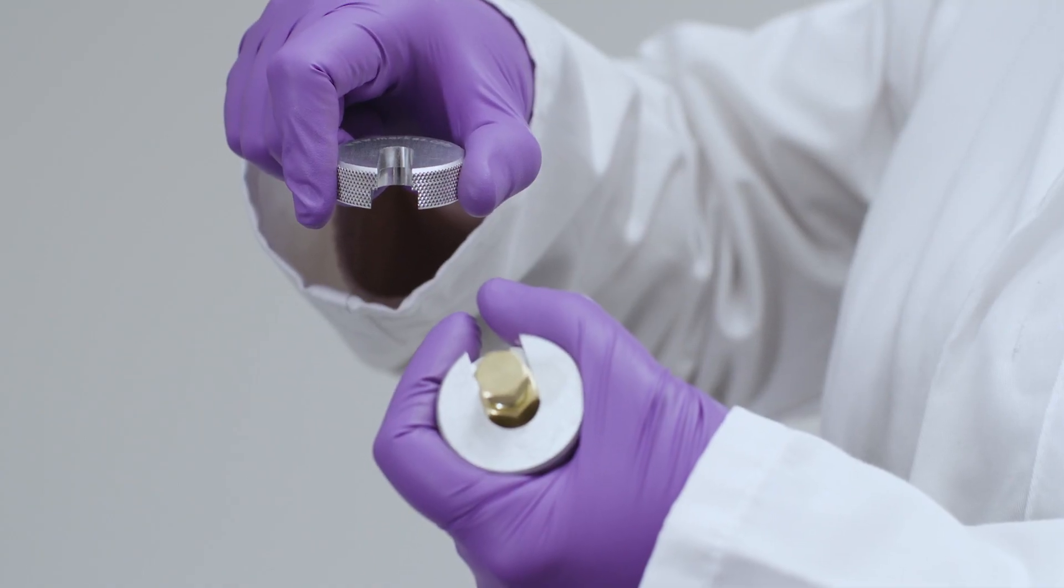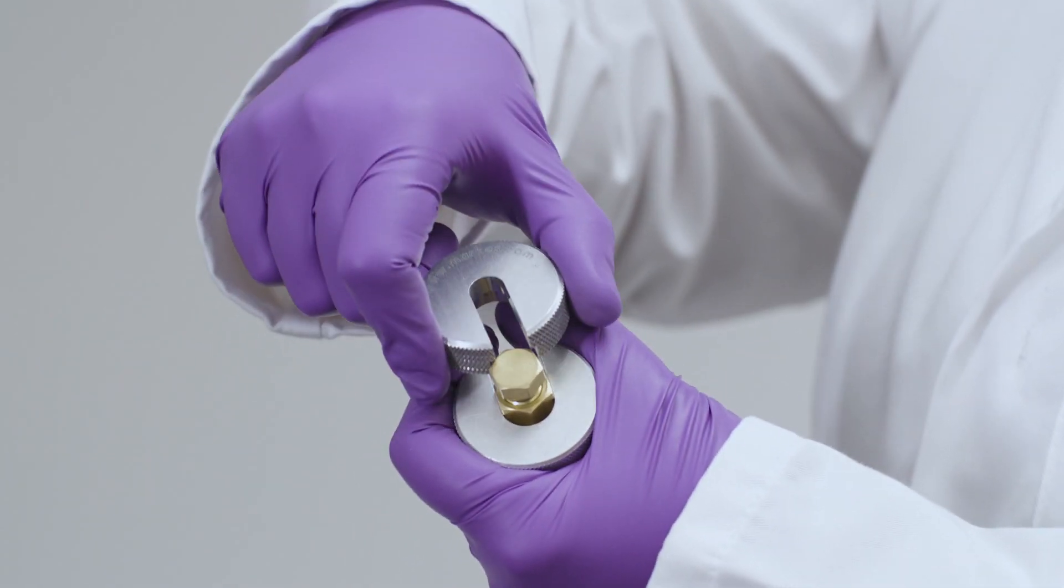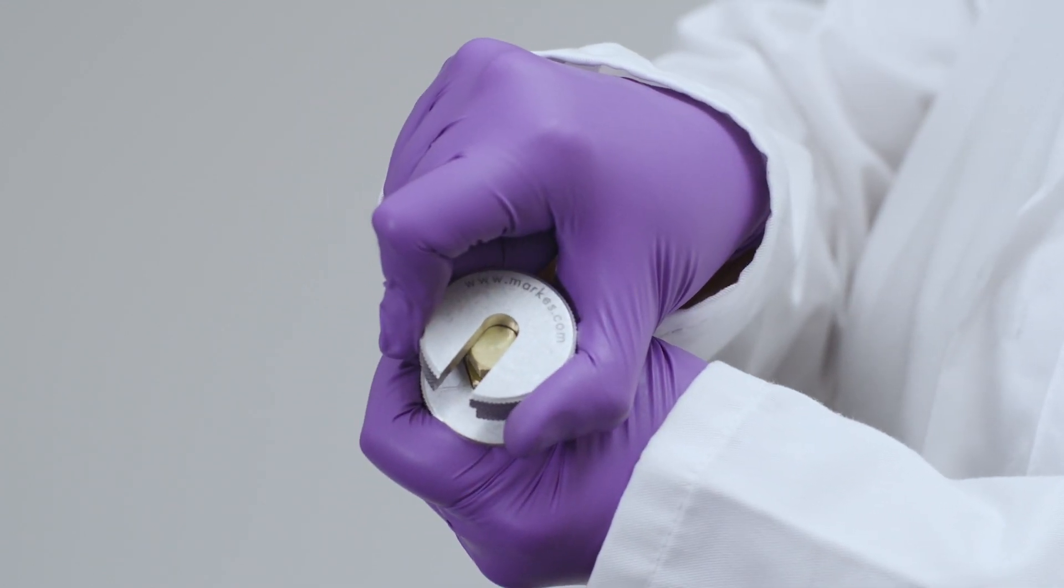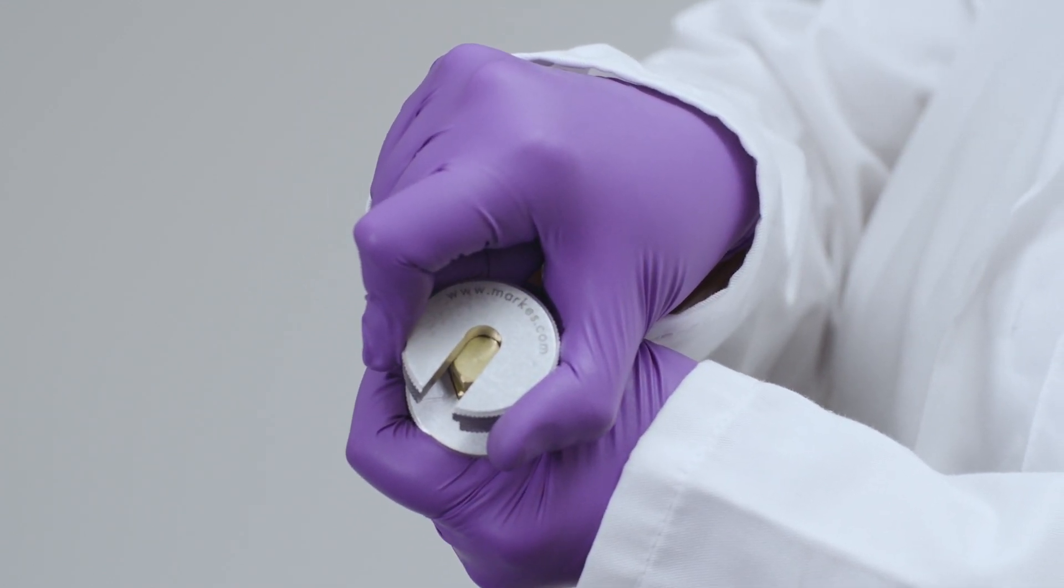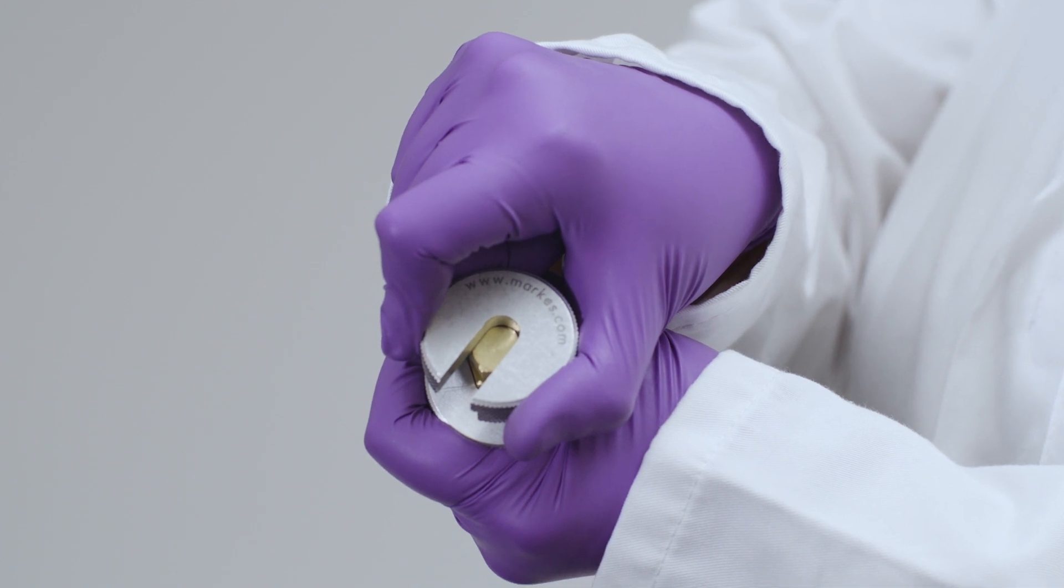You can then slide the top of the cap lock tool over the top of the storage cap. Quarter turn in a clockwise motion to secure the cap. Repeat the process to secure the second cap.